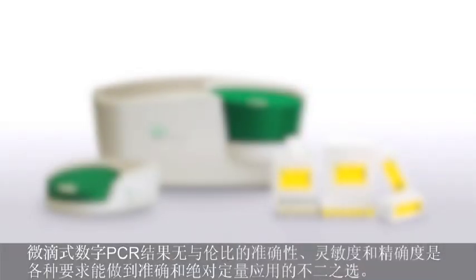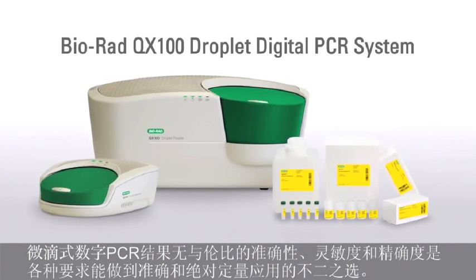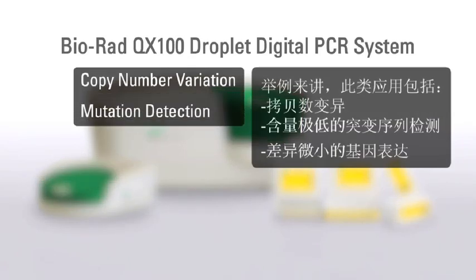The accuracy, sensitivity, and precision of droplet digital PCR enable a wide variety of applications that require accurate, absolute quantification. Examples of these applications include copy number variation, mutation detection, and gene expression.